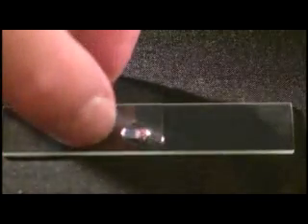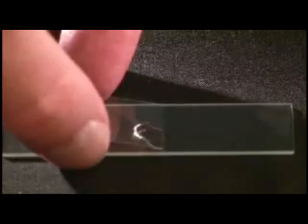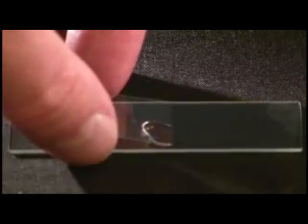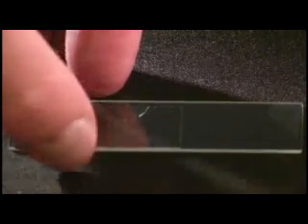Be very careful. Cover slips are thin glass and are very fragile. Place a cover slip on top of the drop, placing one edge on the slide, and then carefully lowering the cover slip onto the water drop. It may take some practice to get this right.